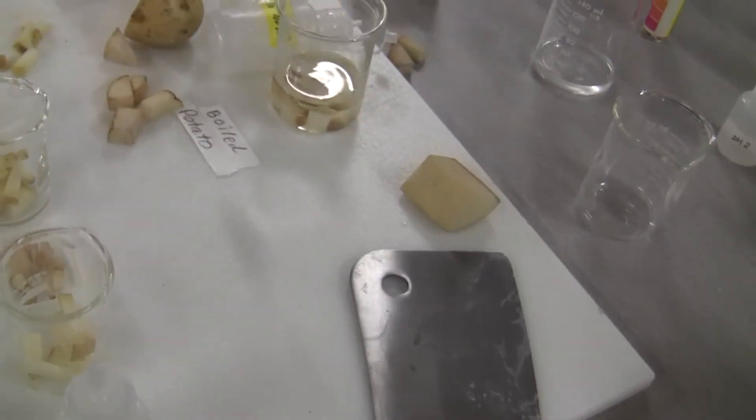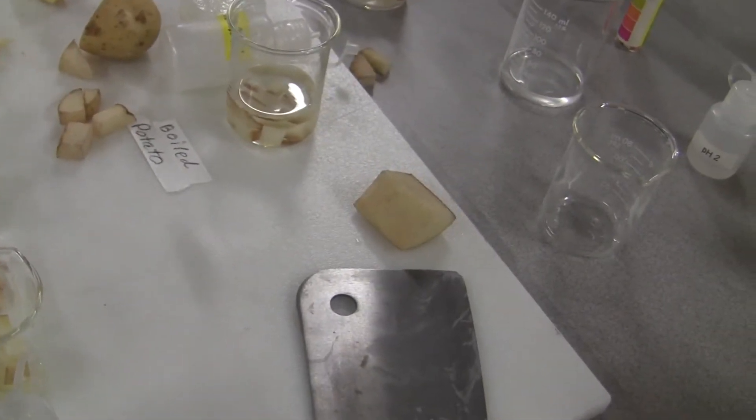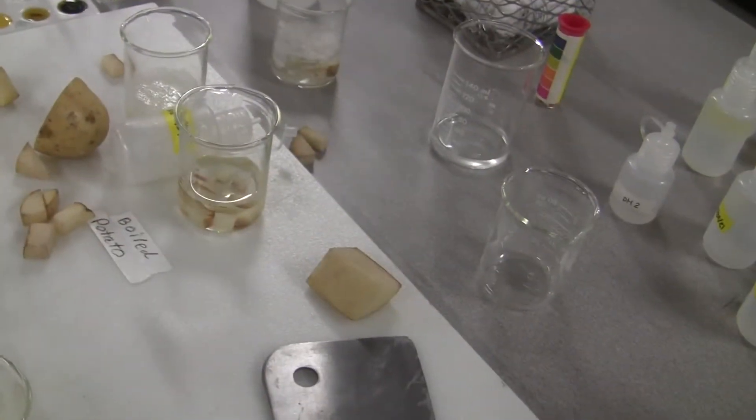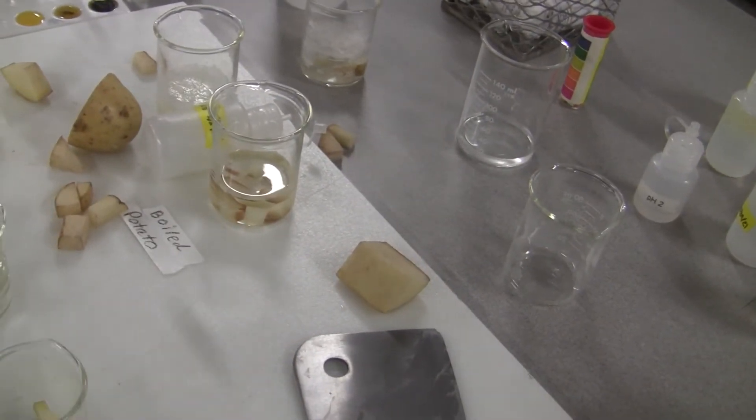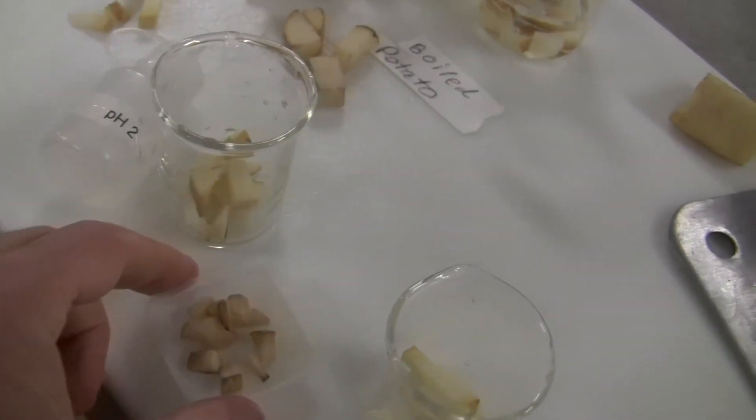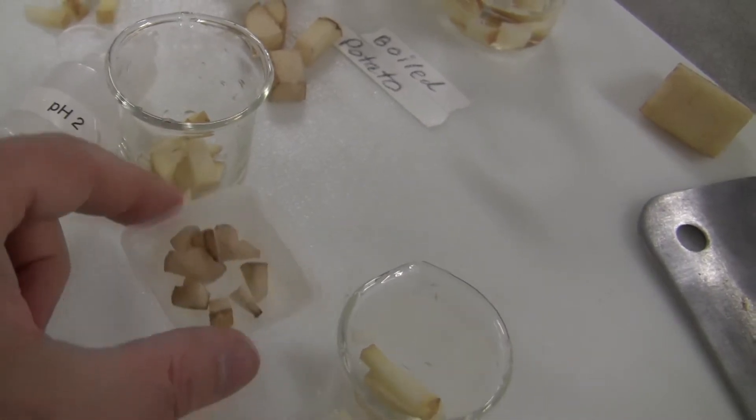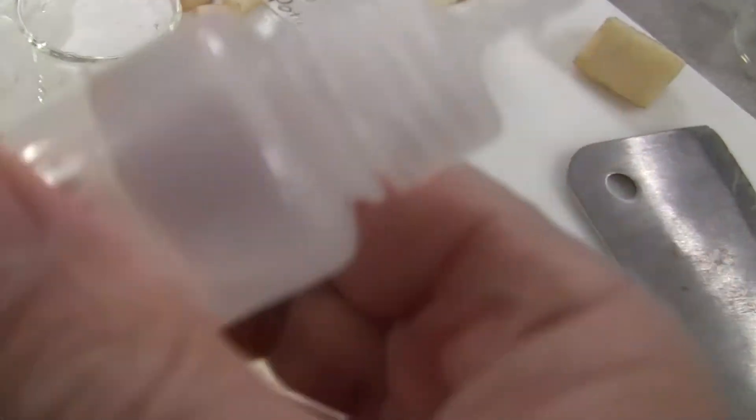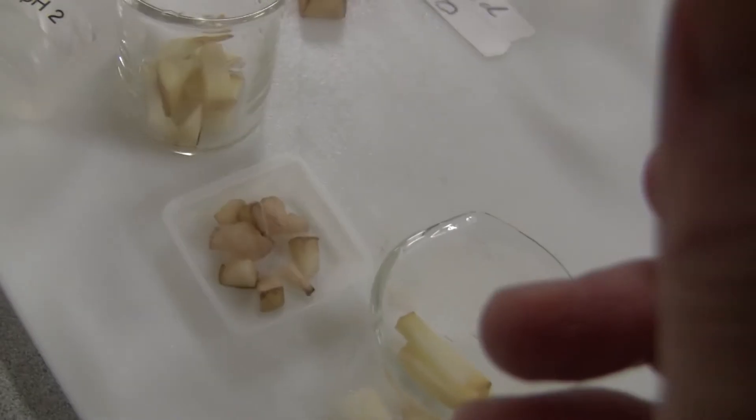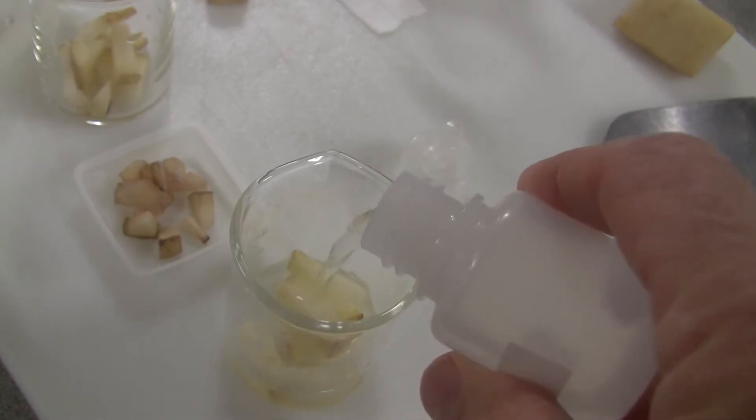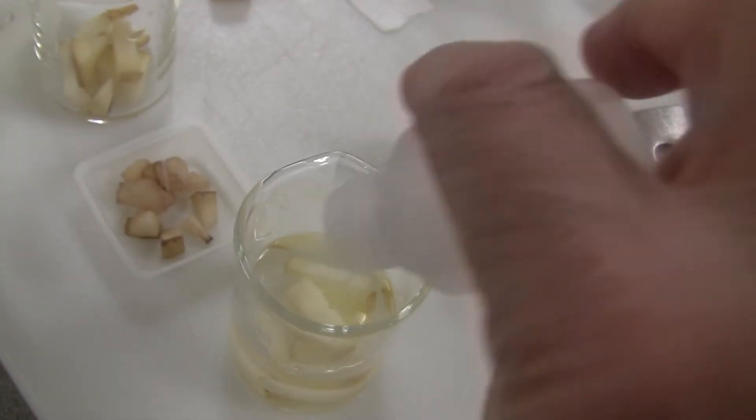And then the camera cooperates with me. And then when I pour those, of course I weigh them. These are about 2 grams. About 2 grams I put it in a dish like this. Of course they've been sitting around for a while. So here is pH 9. I dump it. I should have opened it before. And then we have to wait a little bit.